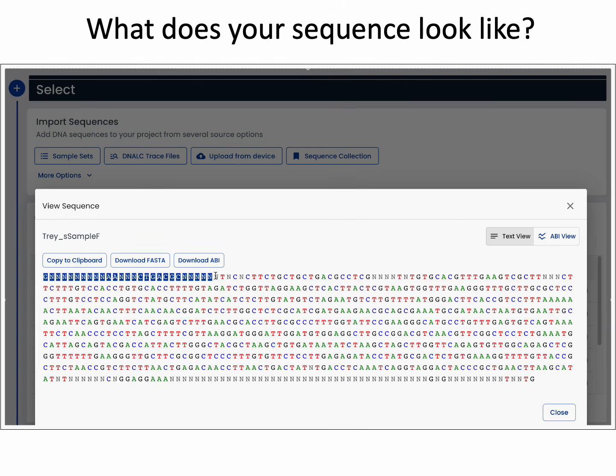Typically, when you look at a sequence, you're almost always going to have a bunch of Ns on the front end, which represent bad calls or bad sequence, and you'll see the same thing at the back end of your sequence, a bunch of Ns at the end. But typically, all the stuff in between those two front and back tails looks good.